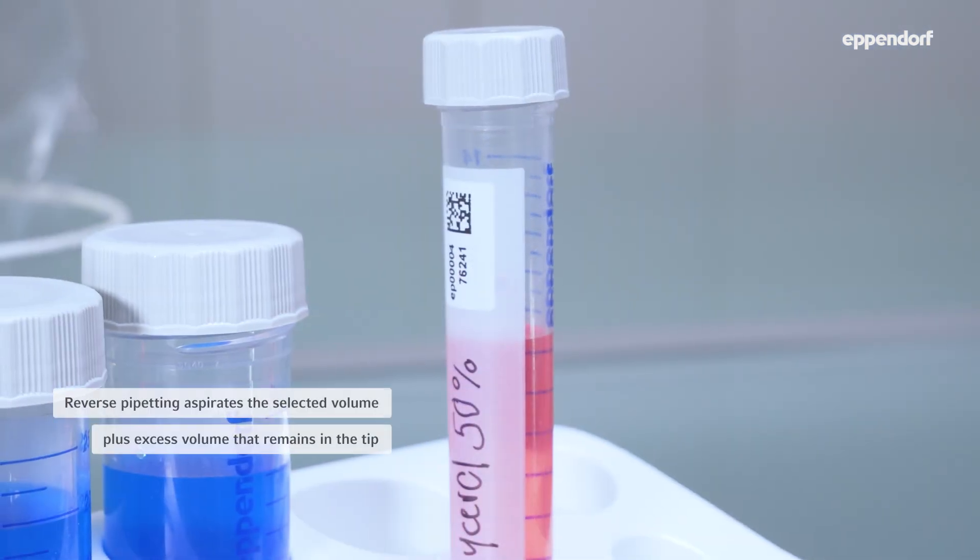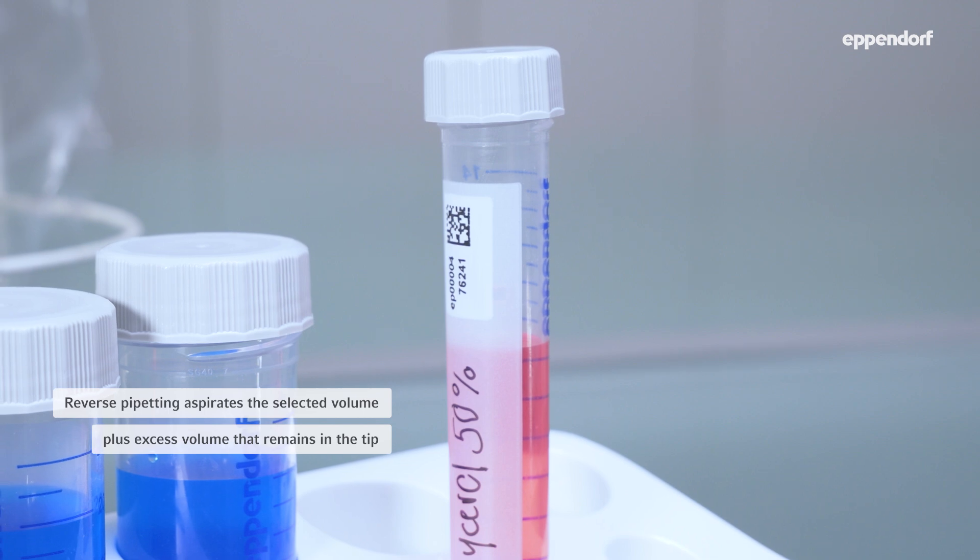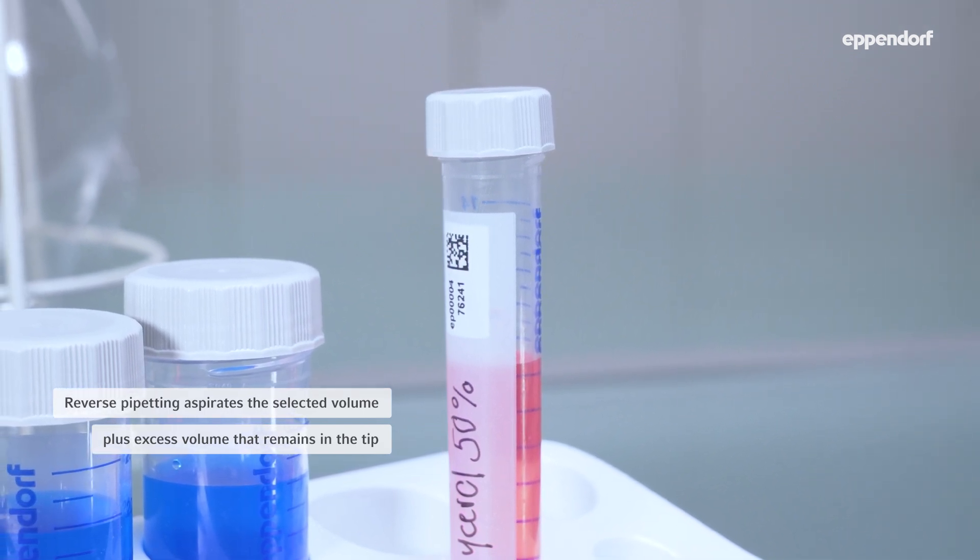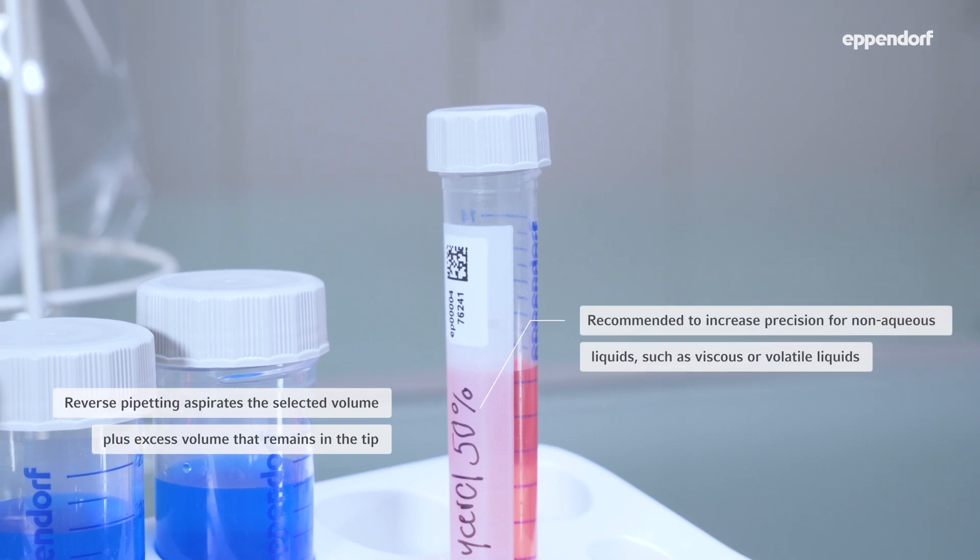When using the reverse pipetting technique, the pipette aspirates the selected volume plus an additional excess volume that remains in the tip. Reverse pipetting is recommended to increase precision for non-aqueous liquids.